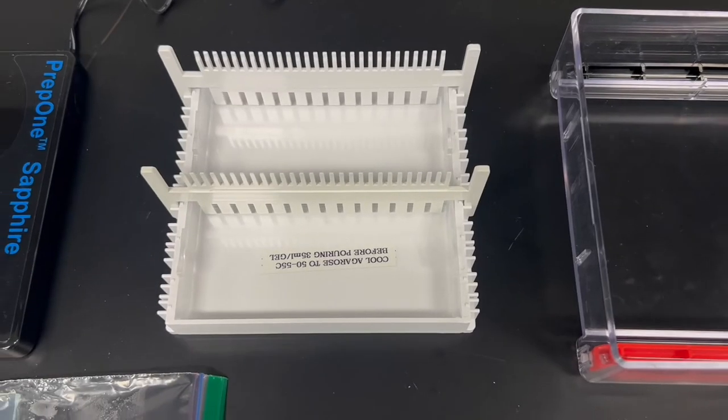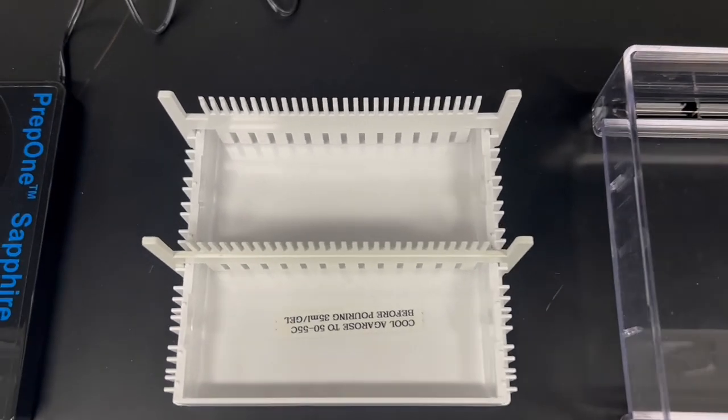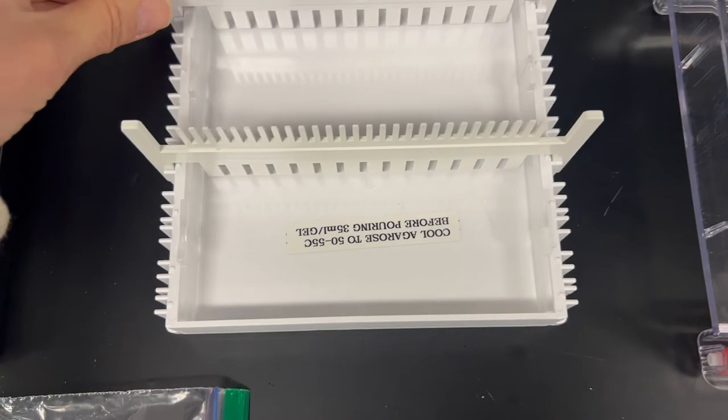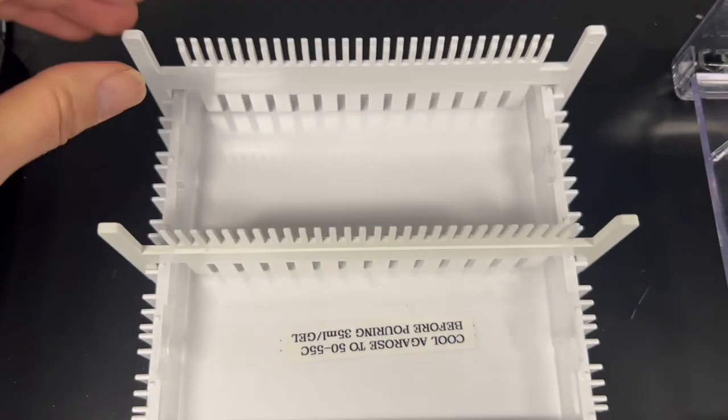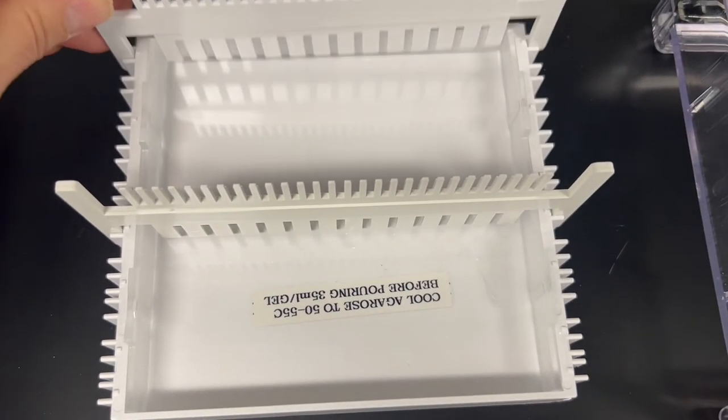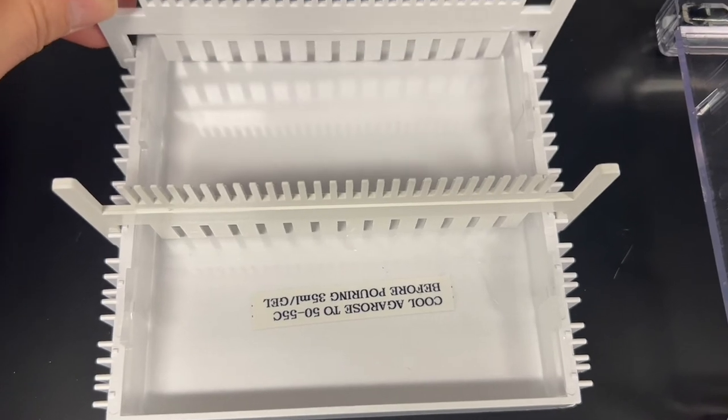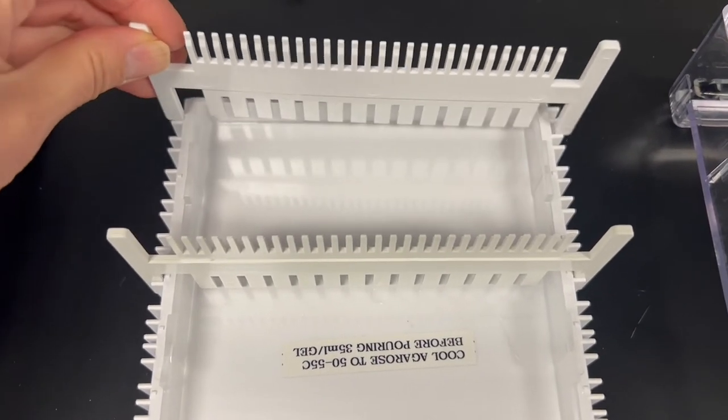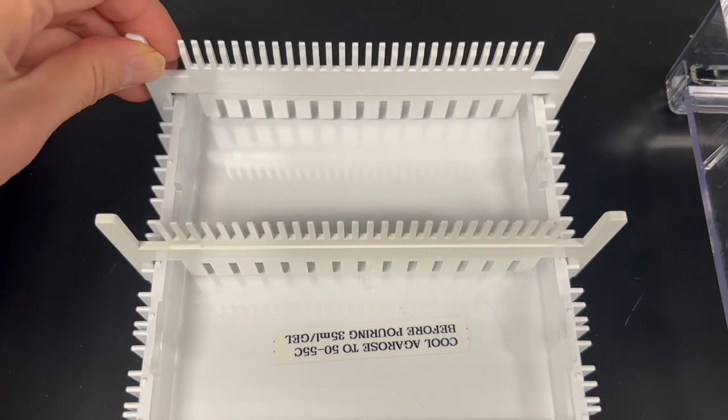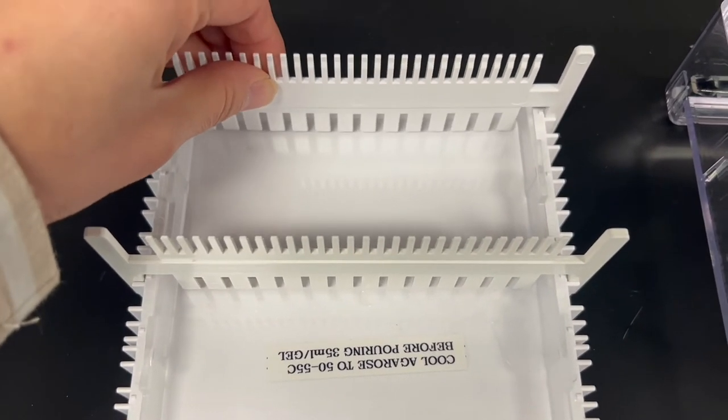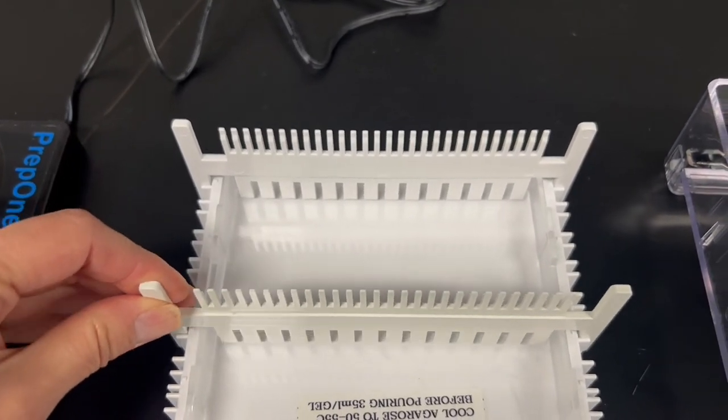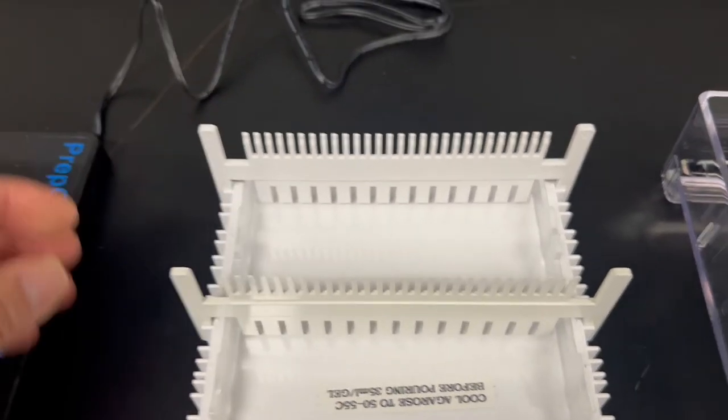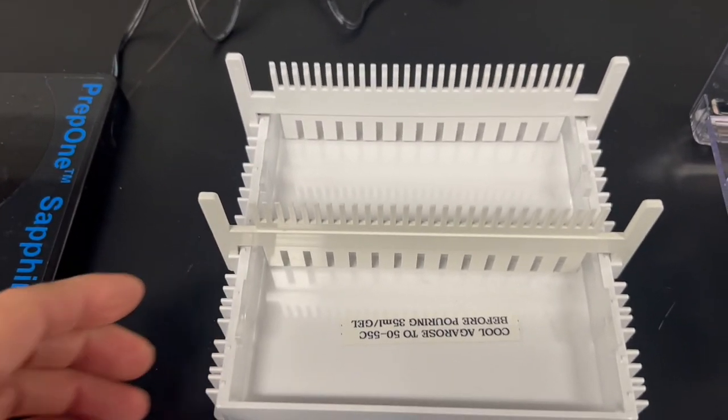I wanted to show you the setup for casting your gels. So these are the combs that we use with the 14 wells. And make sure the combs aren't too tight. Some of them sit kind of tight. So when it comes time to remove them, they actually damage the gels. Make sure it's kind of loose fitting so that when you remove them, you won't break the gels. So that's how I set it up.